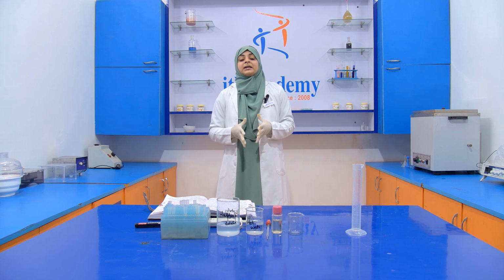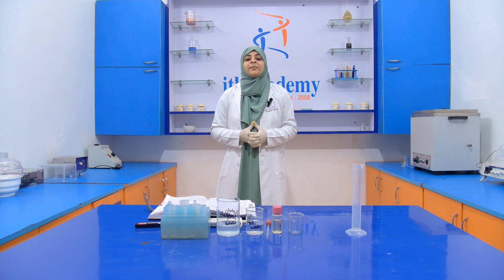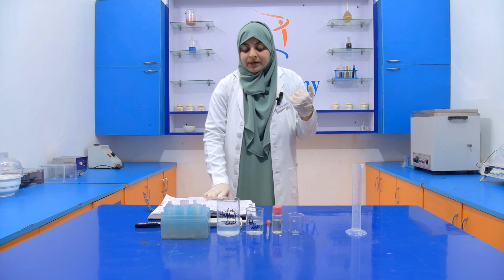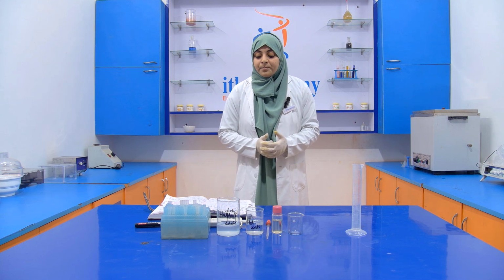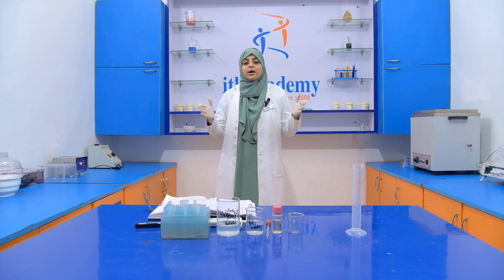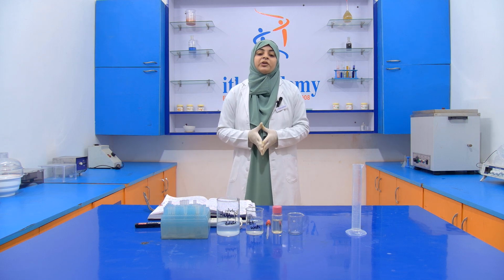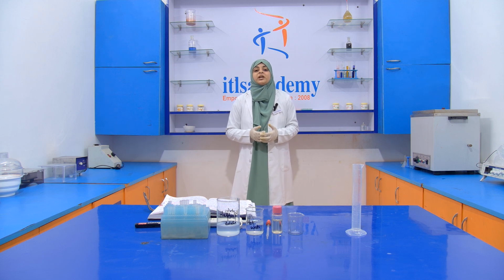Even traces of pesticides are also present in cottonseed, which are very harmful. Now this cottonseed oil is added into the edible oil to maintain its stability and neutral flavor and also maintain a longer shelf life. Okay, so the reason behind the addition of the cottonseed oil into the edible oil is what? To extend the shelf life of the edible oil.